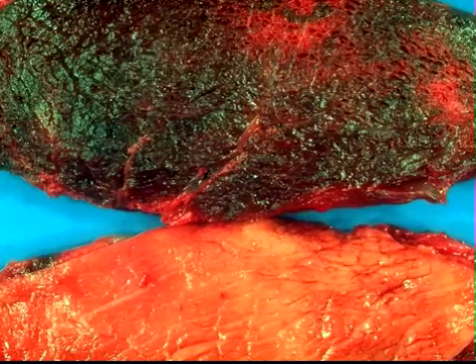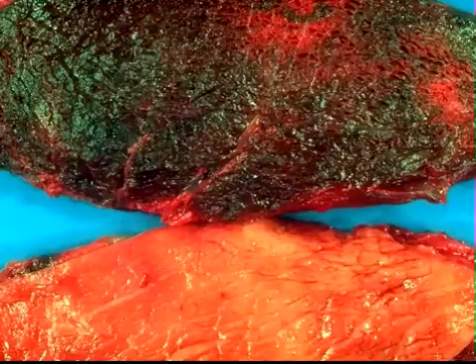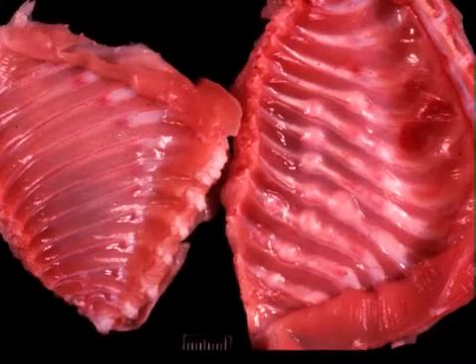Let's go on to another question. This is tissue from a kitten. I would like you to name the disease. We'll just leave it at that. Let's just name the disease today. Okay, time's up. This one takes a little bit of thought.